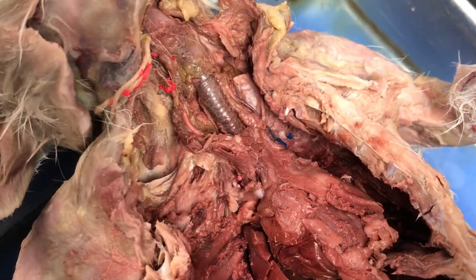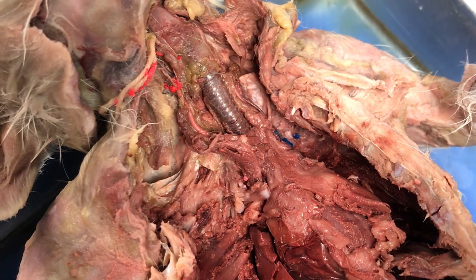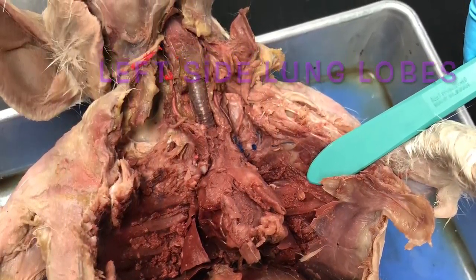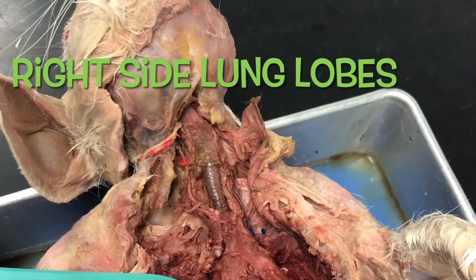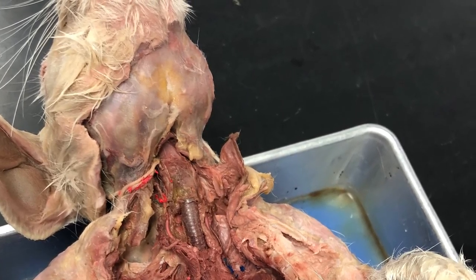There's the trachea and those tracheal rings. Here are the lung lobes of the left side of the rabbit, and then the right side lung lobes. You have to be the rabbit — pretend you're the rabbit to determine right from left. Thanks, guys.